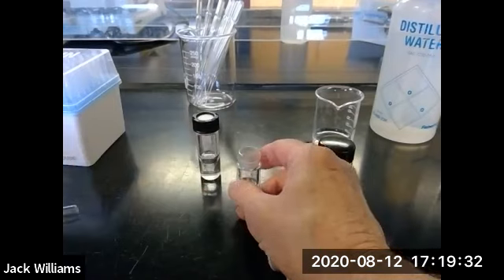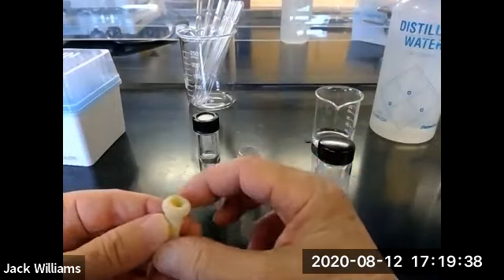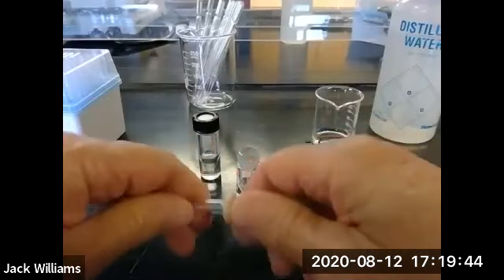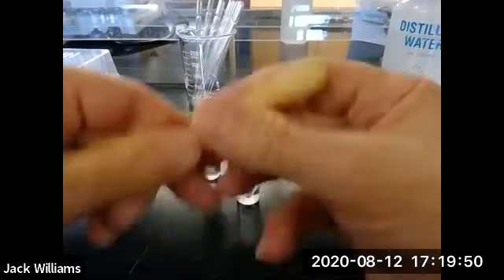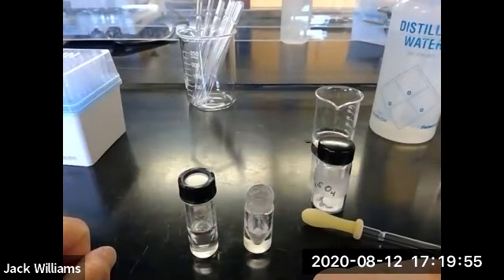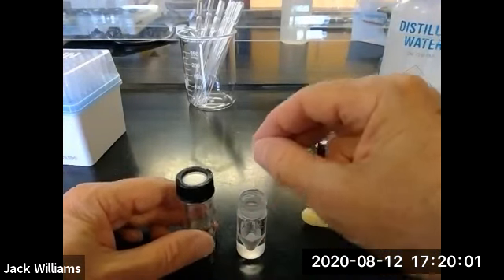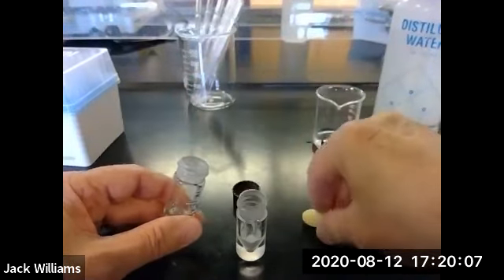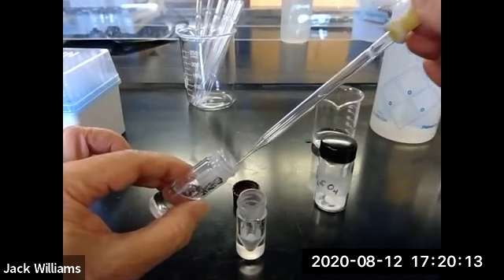And we're going to use a Pasteur pipette, looks something like this. So you take your Pasteur pipette, a little bulb on the tip, on this end, like so. And now to make the transfer, put the two vials close to one another. And the same thing will happen as with the automatic delivery pipette. There's going to be a certain amount of vapor pressure in here that's going to build up. So you want to make the transfer as quickly as possible. So press down on the bulb, into the solution.